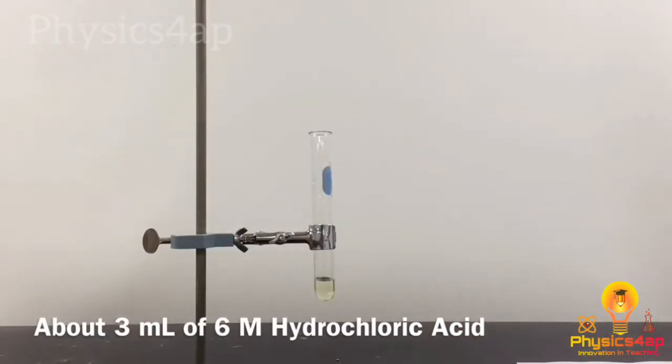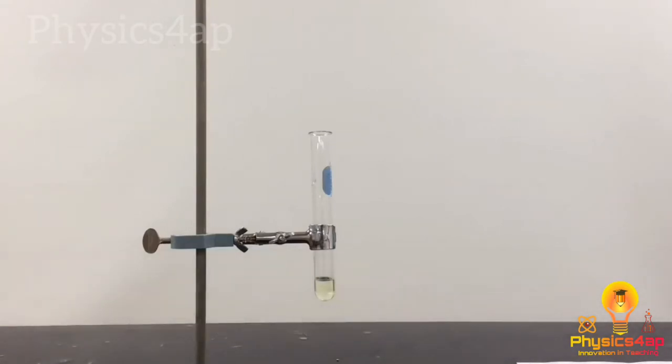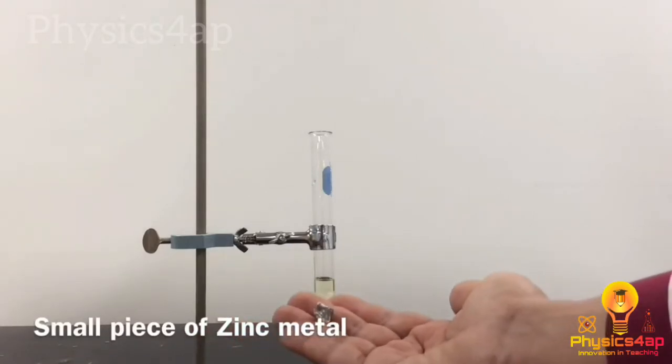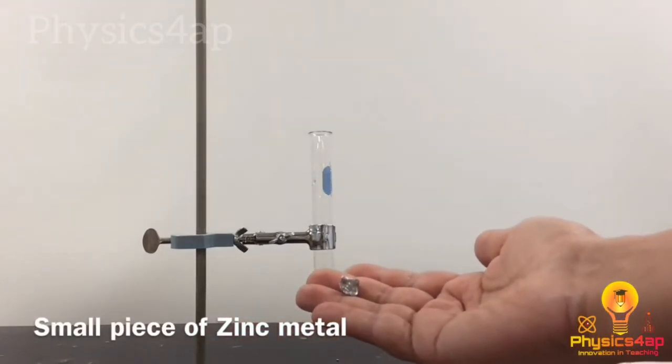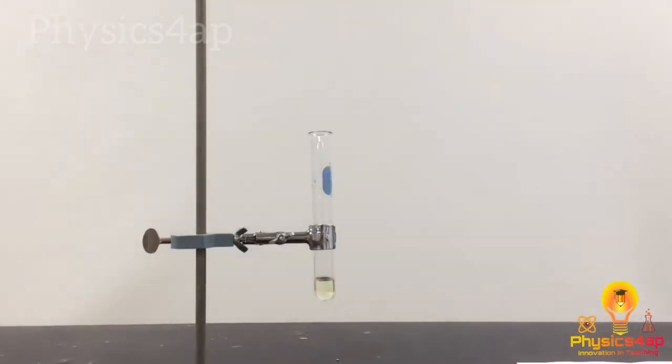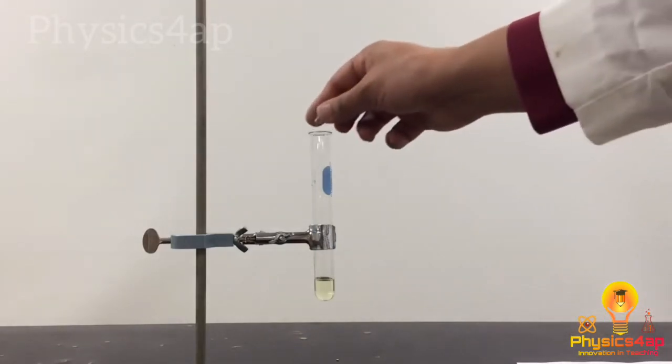This particular acid has a concentration of 6 moles per liter, so it's pretty concentrated. Then I'm going to take a little piece of zinc metal. I have this zinc metal in my hand here, as you can see. It's pretty shiny, just like most metals are, kind of silvery in color. And I'm going to drop the zinc into the acid.